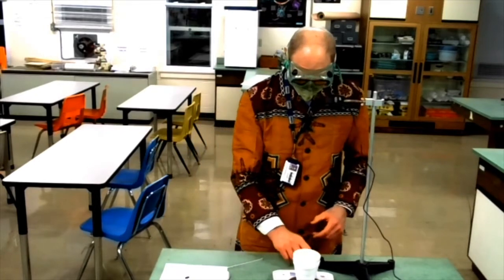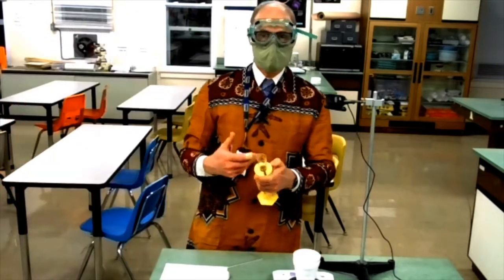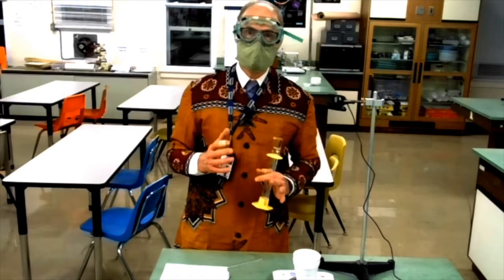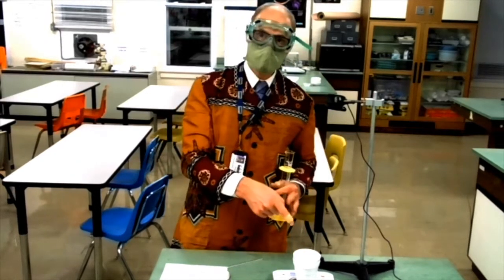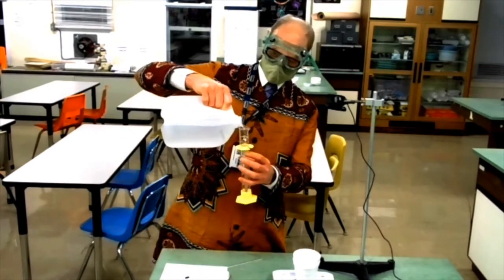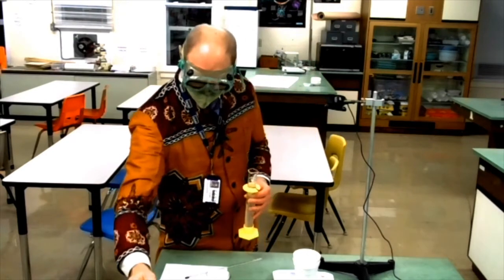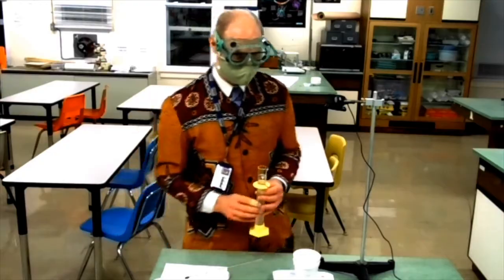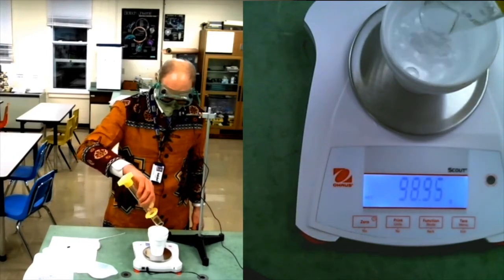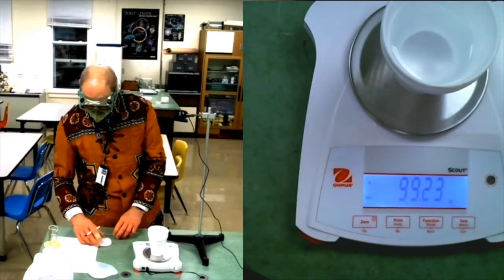To get the water, I'll start out by adding water to the graduated cylinder, measuring up to 100 milliliters. But to be doubly sure that I know exactly how much water I have, I'm going to weigh it on the balance. It's not quite 100 — it reads 99.23 grams — but I will record that.